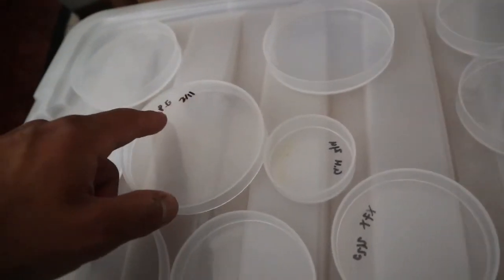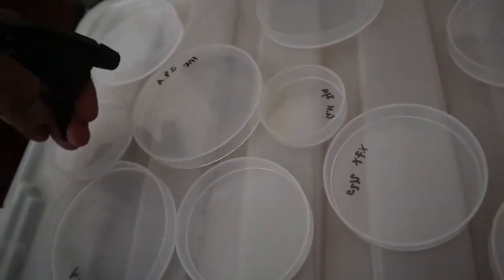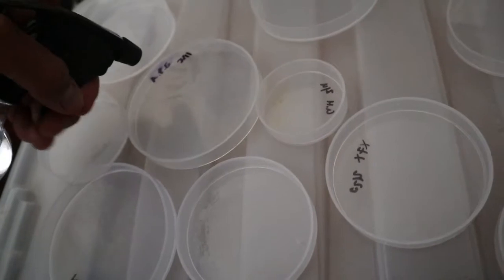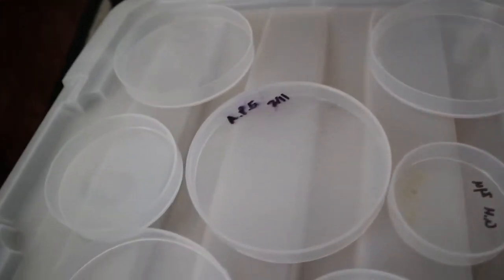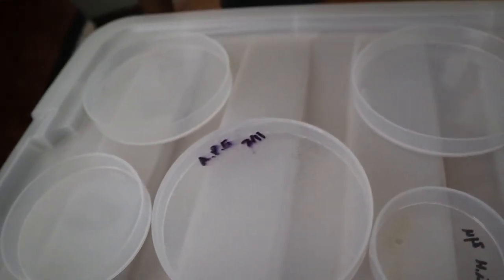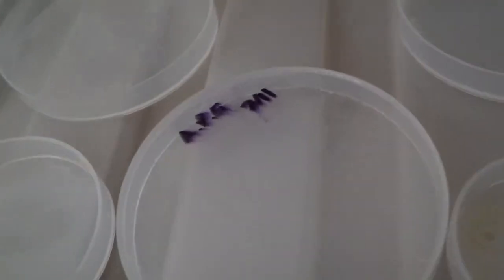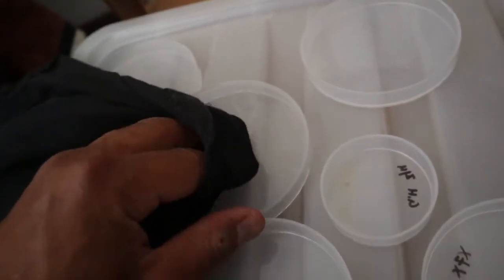And I just go and spray all around my dishes. And now as you guys can see, the Sharpie or whatever, the permanent marker, if you spray it with alcohol, it goes away. Okay, if you guys can see, it's starting to smear off. So what I do is I grab a shirt or like a rag or something and then just wipe it down.